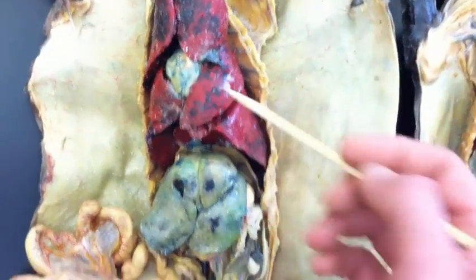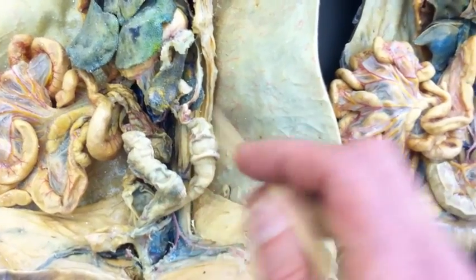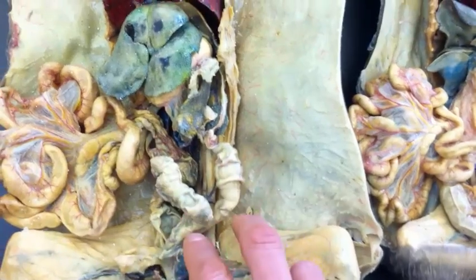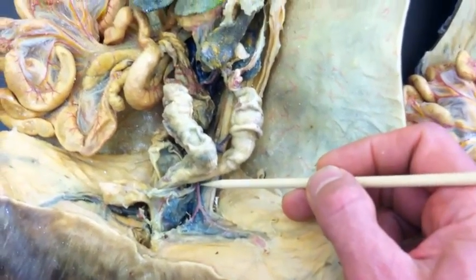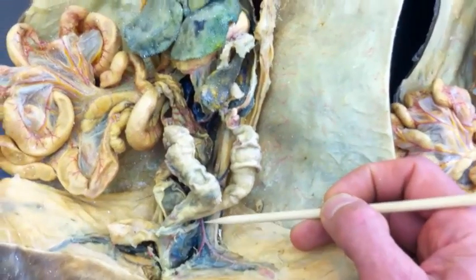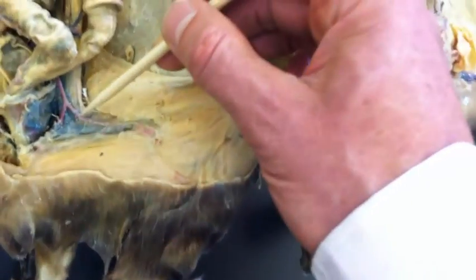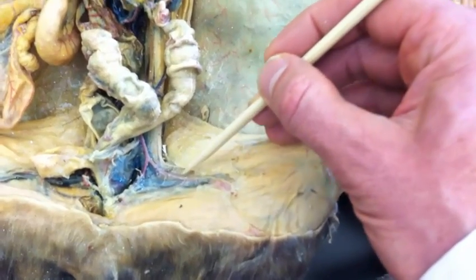There's the heart. And down in the abdomen, this one's really not opened so that we can see. In fact, this is the cat's uterus that's in the way of the major vessels down here. Oh, but wait, look, that's cool. We actually do have an artery coming down here, and what that looks like is the left iliac artery, but I probably wouldn't use this on my students because you can't see it branching, and I like to have those indicators. Oh, I guess one thing I could say is you can see this artery coming out into the leg, so that would be the femoral artery.